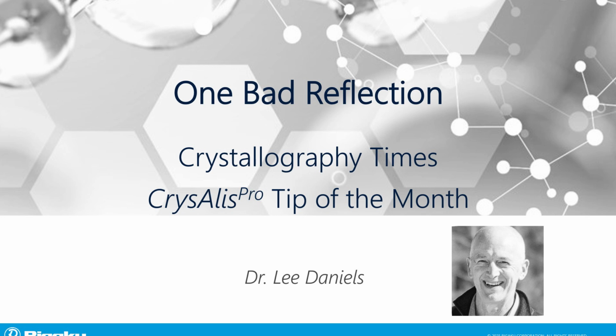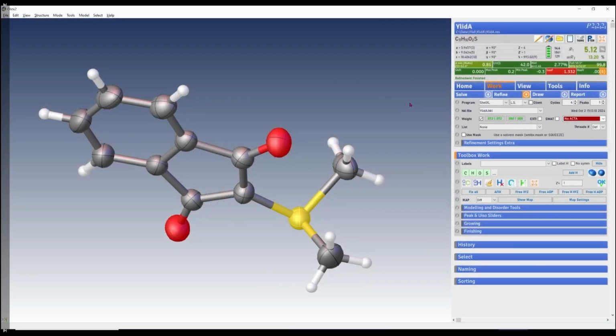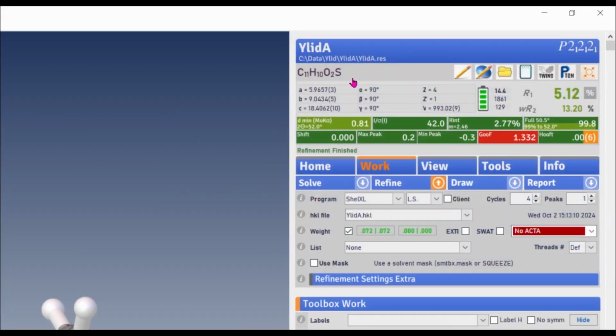I'm your host Lee Daniels, and today we're considering the source of that one bad reflection in your integrated dataset. Here is a structure with a reflection intensity problem. This is a well-known structure. You may recognize it. Let's take a look at the statistics up at the top right of the Olex2 display.